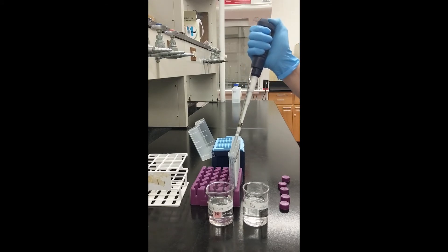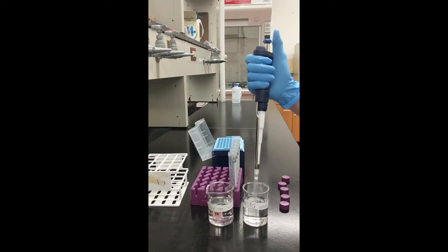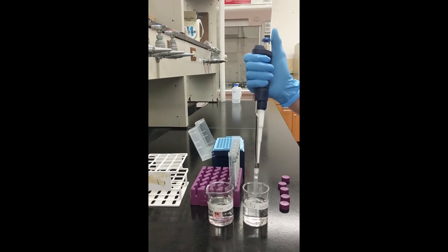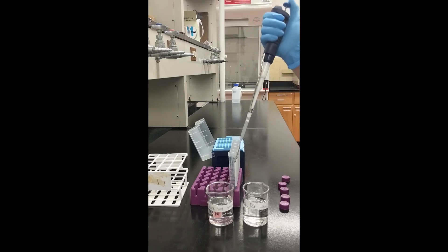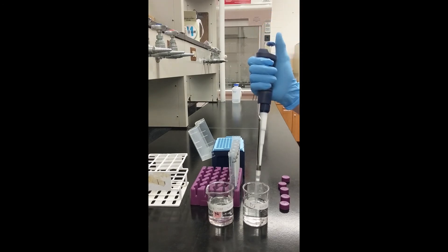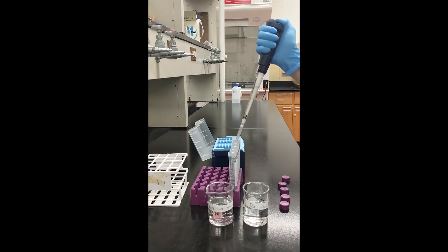I have started by adding deionized water to each of the tubes. Slowly press down on the plunger of the micropipette until the first stopping point. Submerge the end of the tip in the stock standard solution, then slowly release the plunger — liquid will now be aspirated into the pipette tip. Move the tip to a tube and press the plunger to the second stop to release all of the liquid. It is good practice to aspirate the first draw of liquid twice: the first time to wet the pipette tip and the second time for the final volume, as the first draw can sometimes be less volume than desired. Pre-wetting the pipette tip will eliminate this potential source of error.